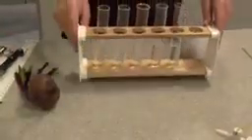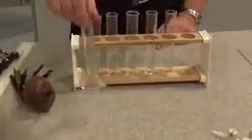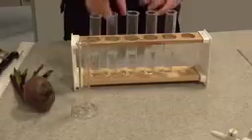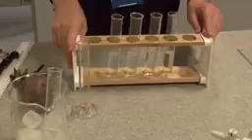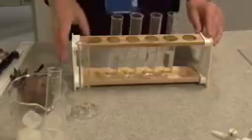Now, the first thing you have to do is get yourself some boiling tubes, and all you need is 20 centimetres cubed of water in each boiling tube. This is at the very start of the experiment, and then you're going to place these in water baths set at different temperatures. So I'm going to place the 0 one in an ice bath there, and then I'm going to place the others, the 20, 40, 60 and 80 degrees C, in various water baths, and I'm going to leave them to equilibrate, in other words, to come to the desired temperature, whilst I prepare the rest of the experiment.